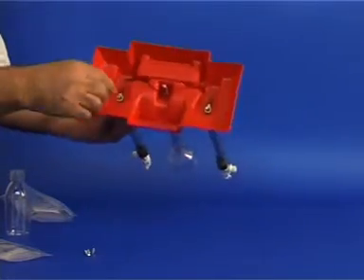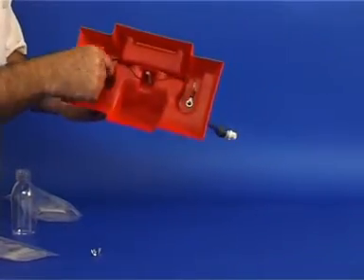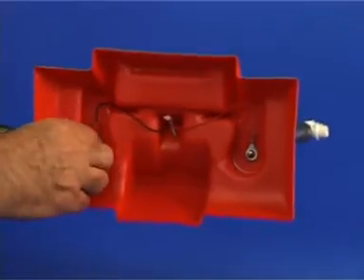Turn the base on its side and use the butterfly screw to tighten the wires to the screws in order to have a good electric contact.